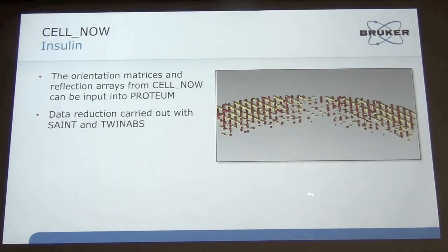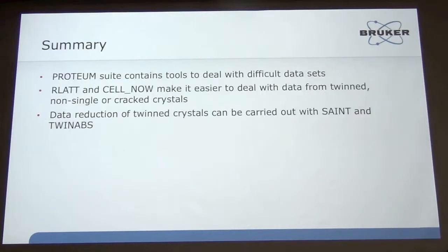Then looking at it in RLATT again, you can see the two different lattices. So you can take that data from CELL_NOW back into Proteum, and look at RLATT to see what the reflections look like. I just wanted to give you a quick idea of the Proteum software. A lot of you probably aren't familiar with Proteum, so if you have any questions, there are a lot of tools like this to help you deal with difficult samples like this.